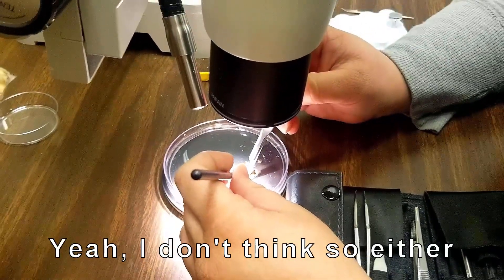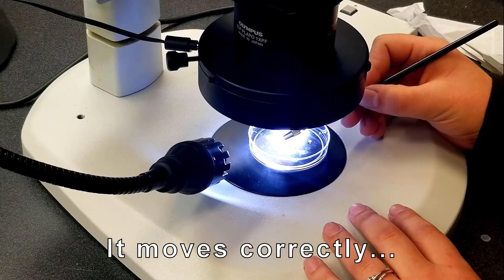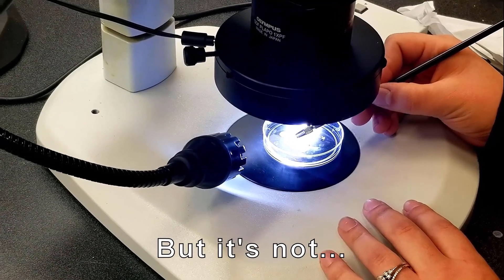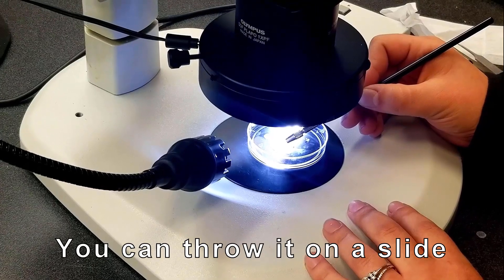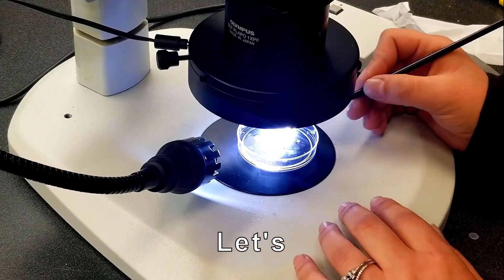But I don't know if that is or not. I don't think it is. Yeah, I don't know either. It moves correctly, yeah, but it's not. I was like, throw it on a slide and put it under the scope. Oh, I'm down, let's mount it.